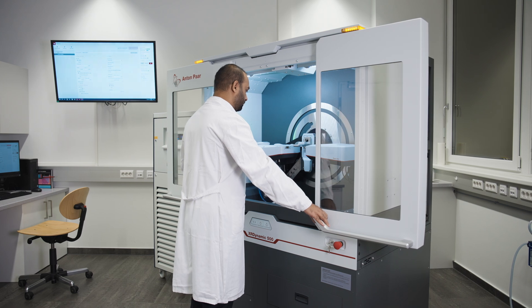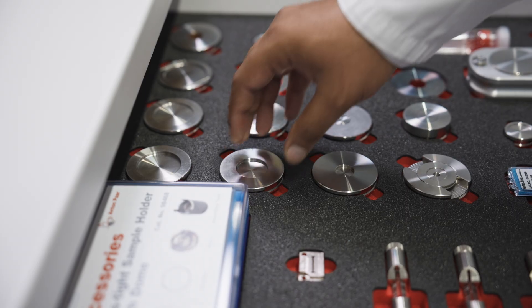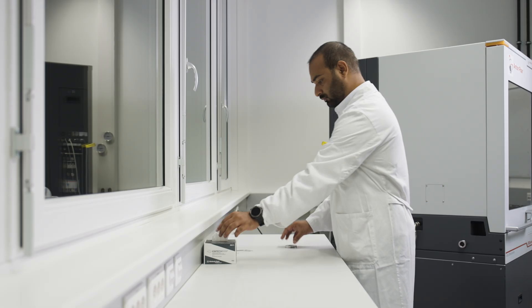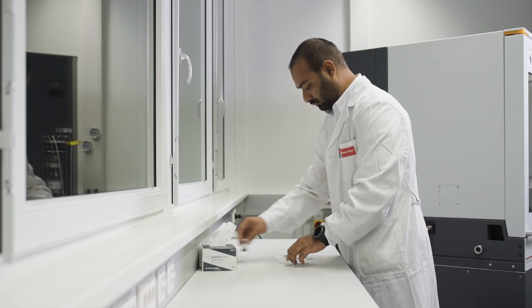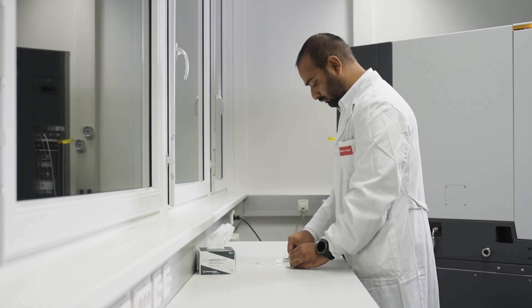For XRD measurements, there are different sample holders from which to choose, depending on the type of material being analyzed — for example, whether or not the material is sensitive to air, whether the quantities available are limited, and so on. For electrode powders, a front-loading type holder with a cavity is usually enough. It can also be beneficial to work with specialized holders that limit any signal coming from the sample holder itself.